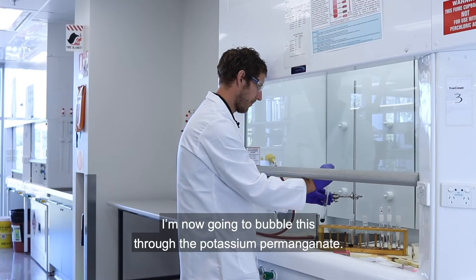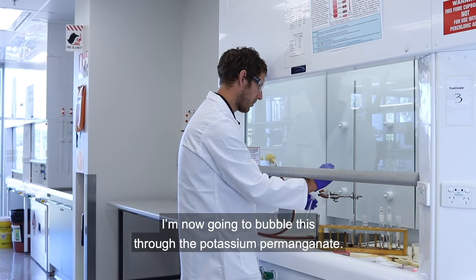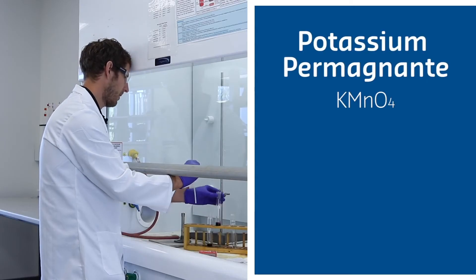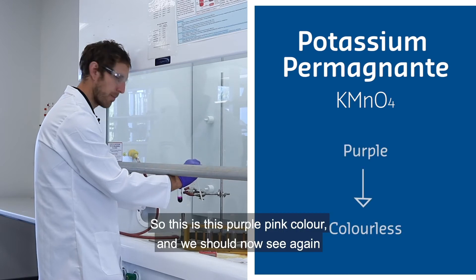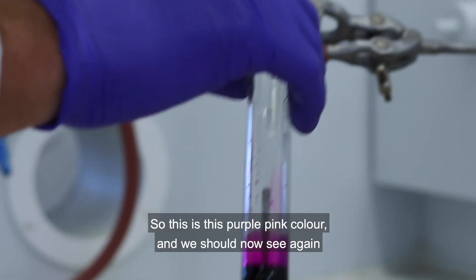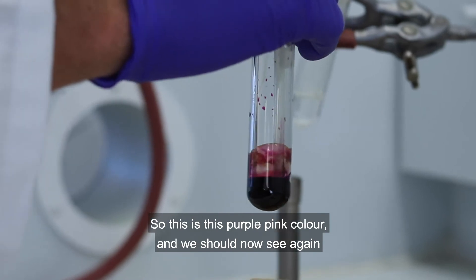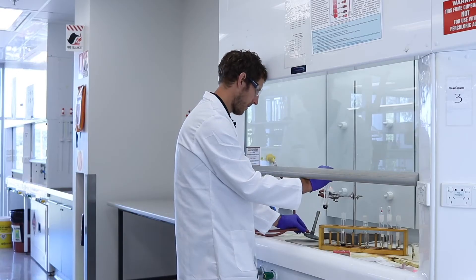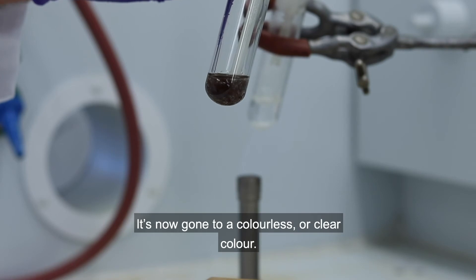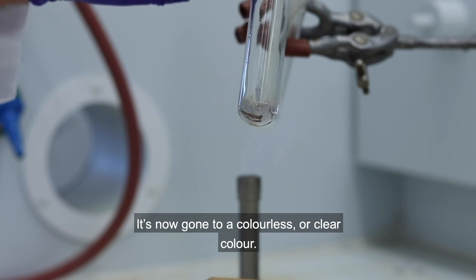I'm now going to bubble this through the potassium permanganate. This is a purple-pink color, and we should now see again a dramatic color change. It's now gone to a colorless or clear color.